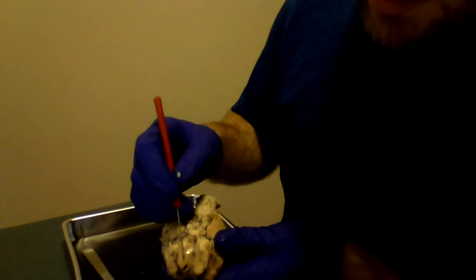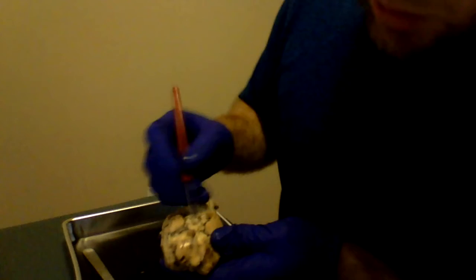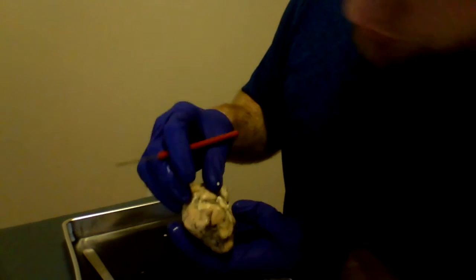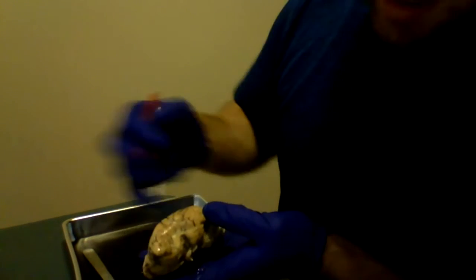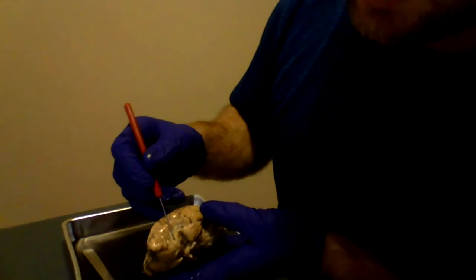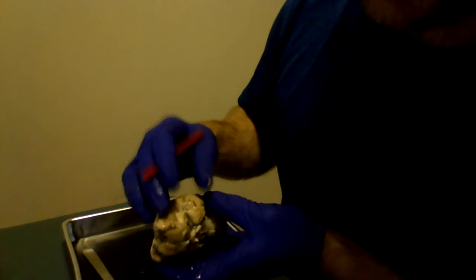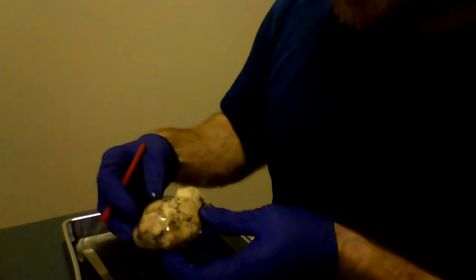We have the enlarged frontal lobe. So, with that being said, olfactory bulb, and on the side here you can see a very well defined olfactory tract, also not mentioned in the video. I did do some further research.